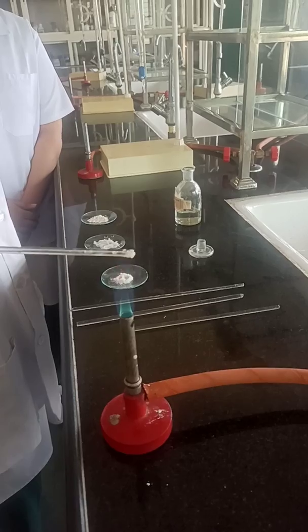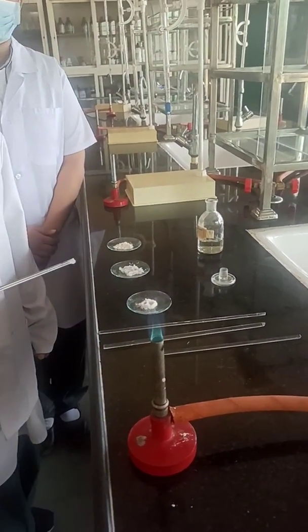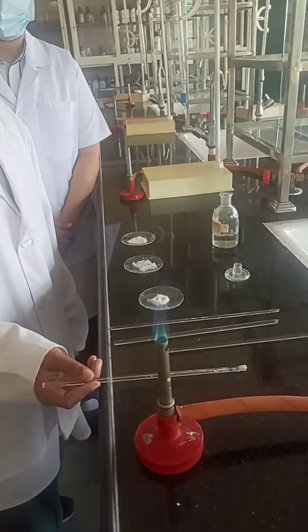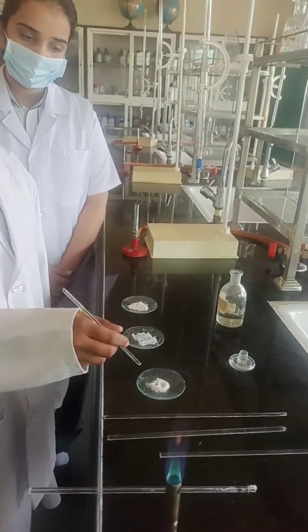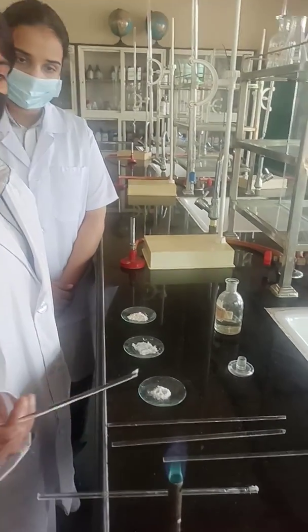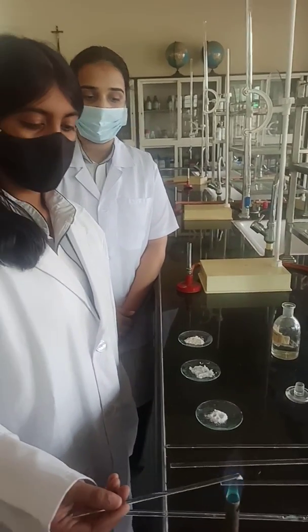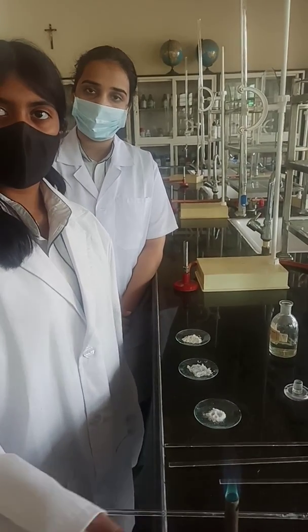This is the green colour. You do not need to repeat it again and again — just one time. In the first attempt only, the colour will be visible. Repeat with another glass rod and add just some flakes of barium. Prolonged heating is not supposed to be done. Can you see the apple green? Grassy green is also how some books write it. So barium imparts grassy green or apple green colour to the flame.